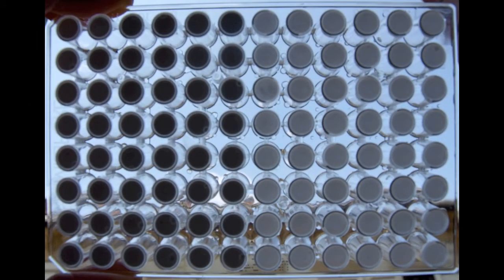Complete hydration results in the membranes becoming translucent. This should be checked for before the assay.